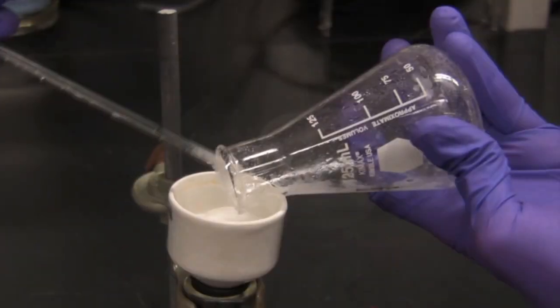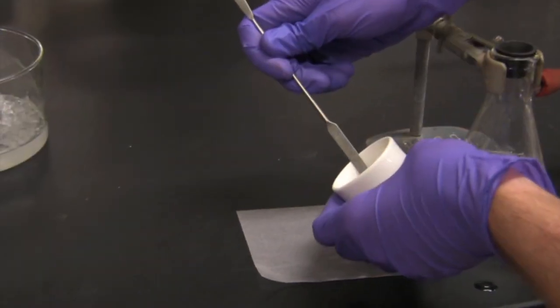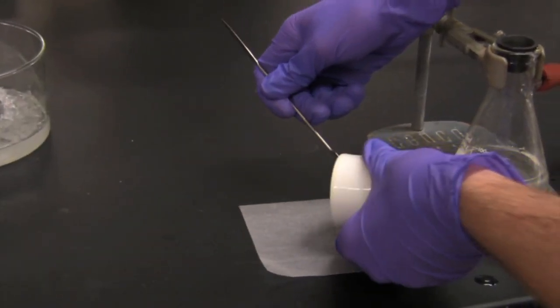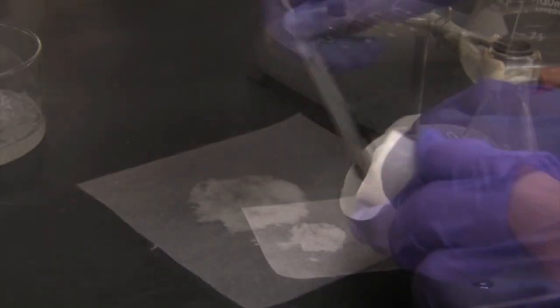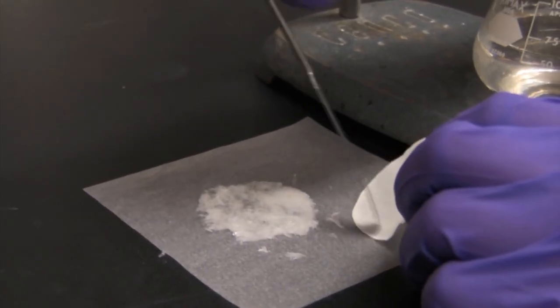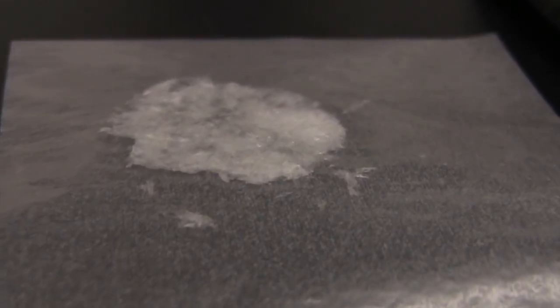Once the pure crystals have been collected in the funnel, vacuum pressure is applied to help dry the crystals in the filter. After the drying is complete, the crystals are scraped from the filter paper onto a sheet of weighing paper, where they are ready to be weighed and stored.